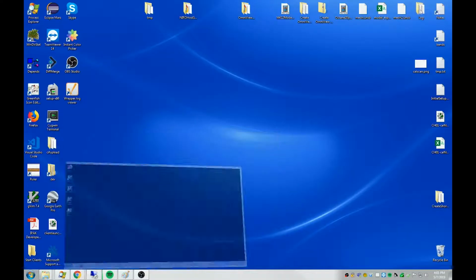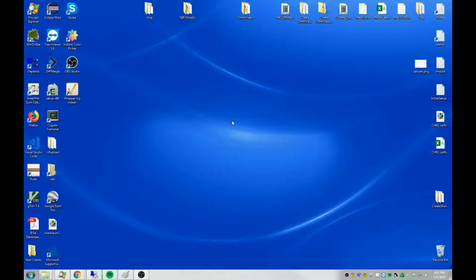All right. Now we're back on my desktop computer, and let's say I want to run a client here, which is really the better way to run OmniView. If you run a client on the server machine itself, it takes up quite a bit of resources and can potentially make things run a little slower. But I understand in some situations where the analyzer is installed in a place where it's not on the network, then that's your only choice. When possible, run your clients on computers outside of the analyzer.